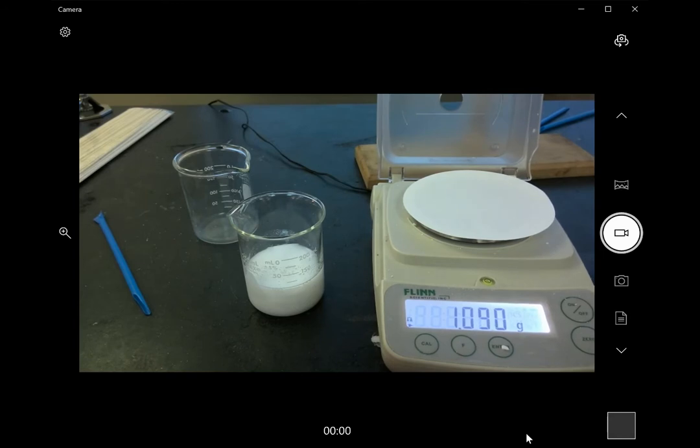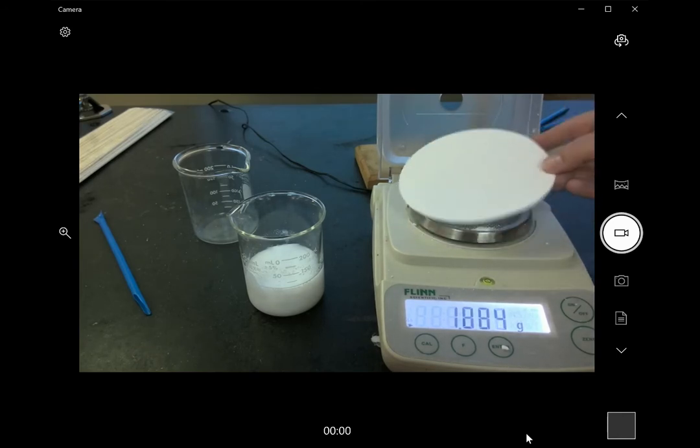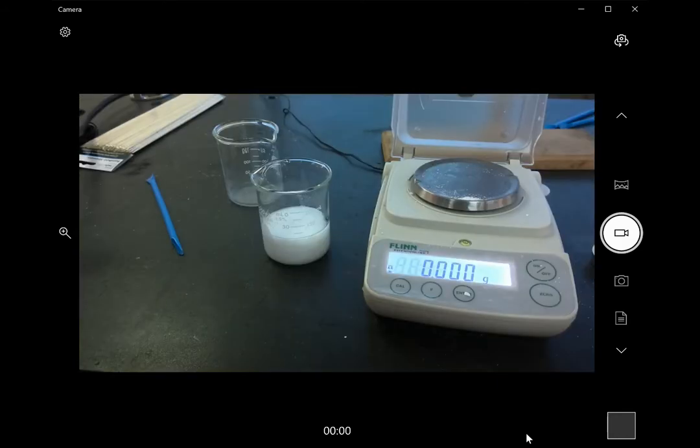And that has a mass of 1.090, so we should record that mass, 1.09 grams. And then I'm going to fold it.